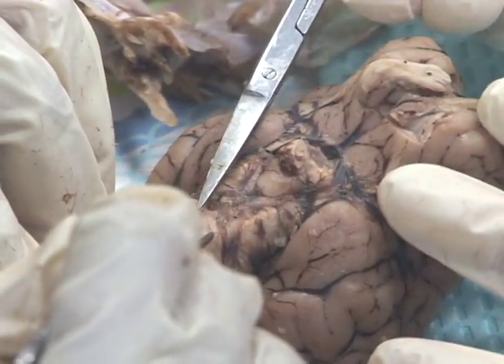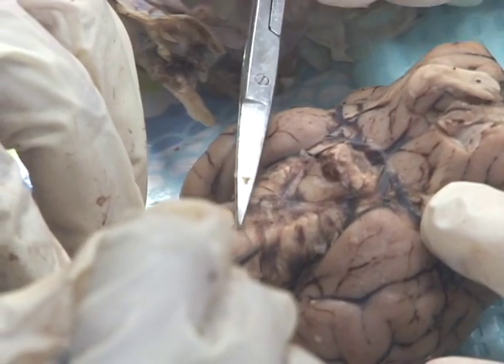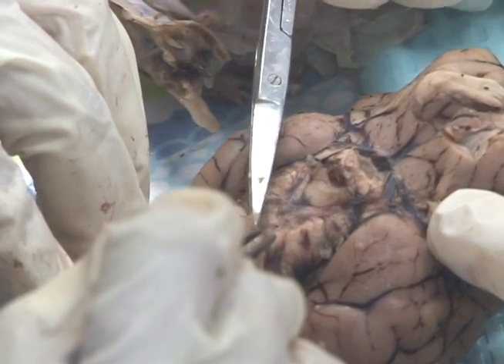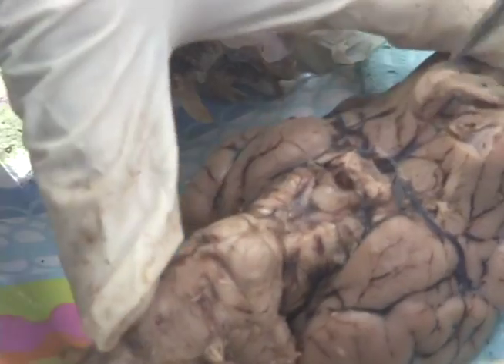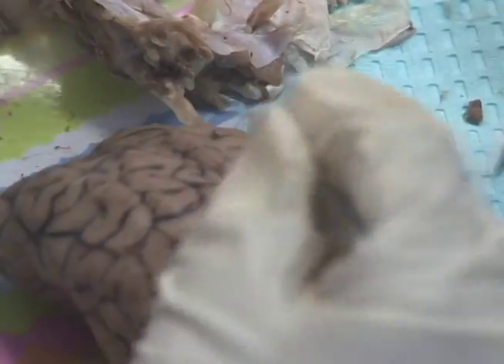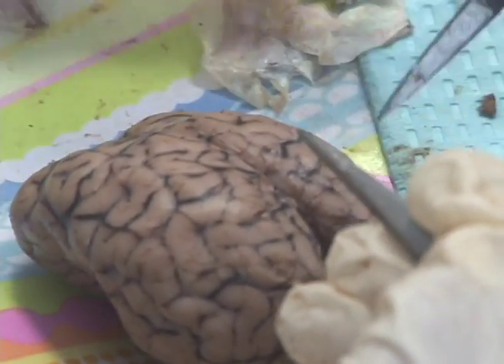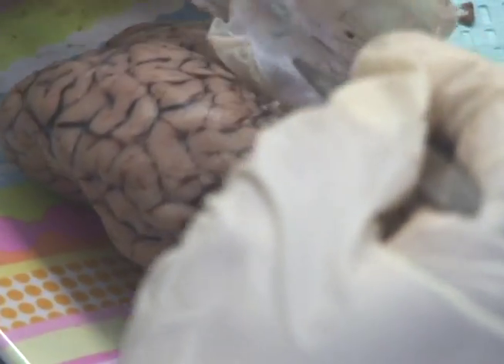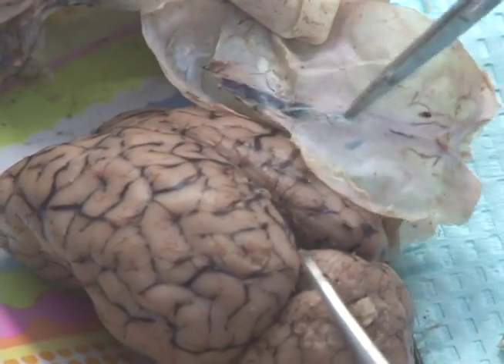The way you can tell blood vessels is you can kind of lift them — get underneath them and lift them up. This is your middle cerebral going laterally, and it provides to all of the brain, all of this part. This is the superior sagittal sinus — that's the venous return.